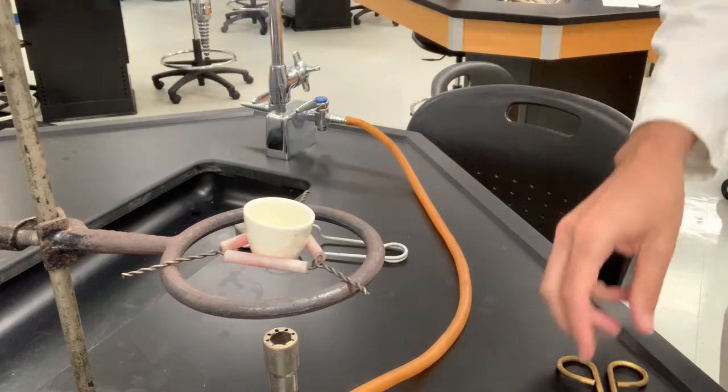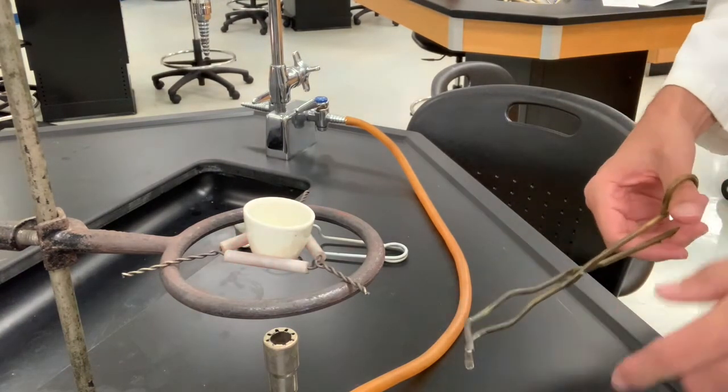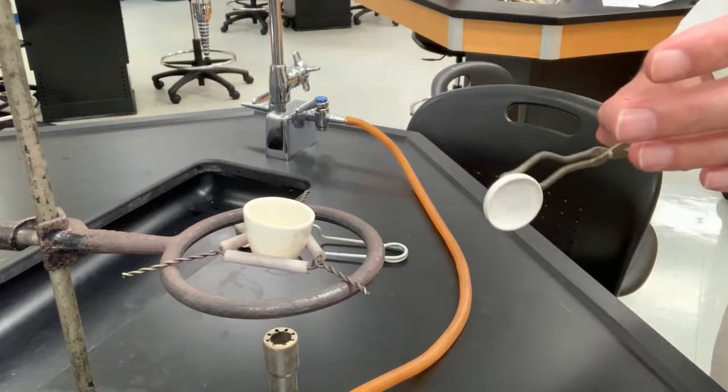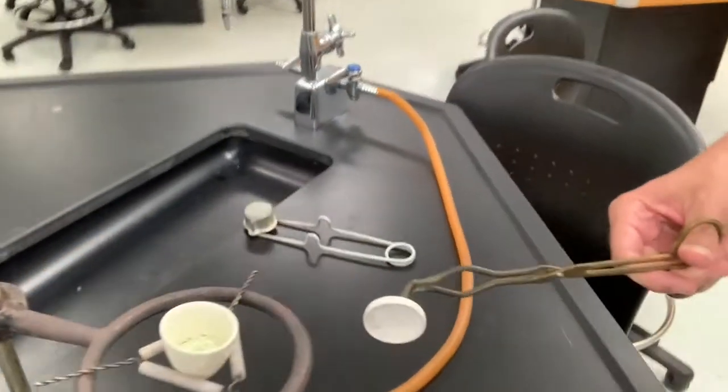It's been about 10 minutes and I'm going to go ahead and cool this down to room temperature. Most procedures want you to cool this while it's covered. And I just want to show you what the crystals look like.